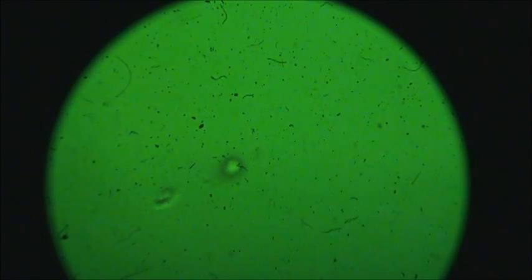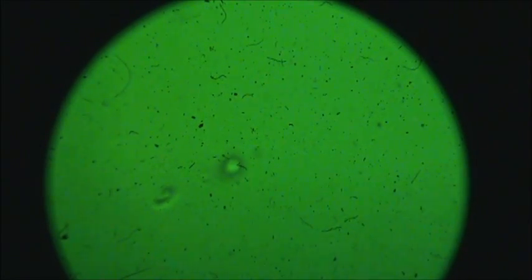So if you're very careful you can suck these cells up and blow them down into the dish and maybe orient them just by easily very gently sucking in and blowing out. So you can actually lay one down like this, bring the other one in and sort of twist around and blow it and get it to where the processes sit together. Then over a few hours they'll form synapses and then we're able to test the synaptic transmission across two cells in culture.